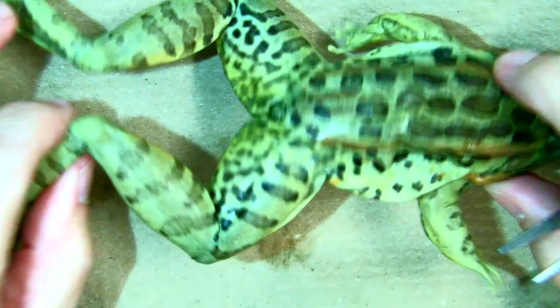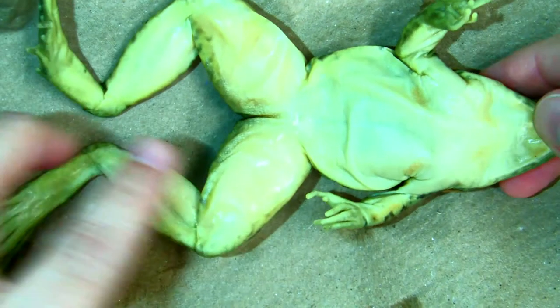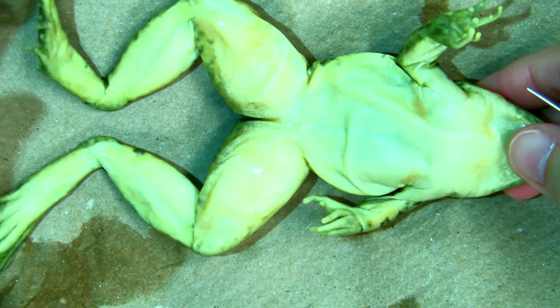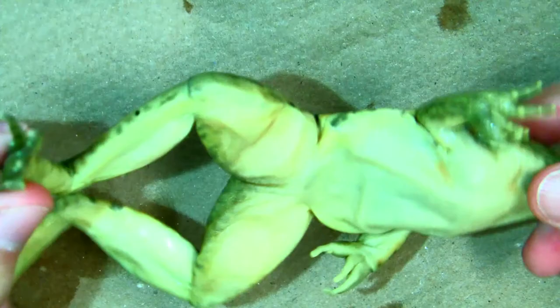A predator from beneath, looking up, they look light, just as light as it does on the surface of the water. So they can blend in that way.